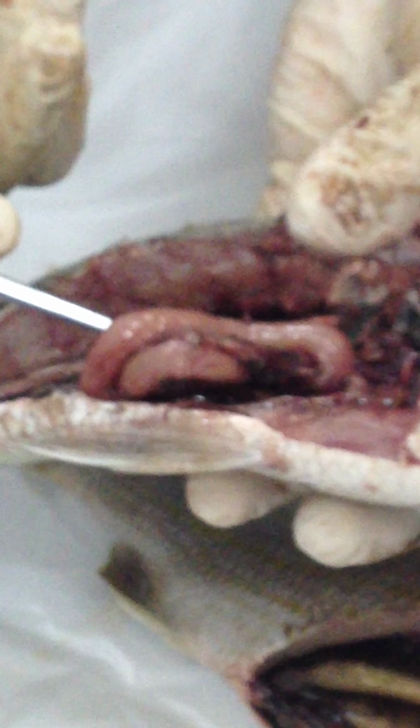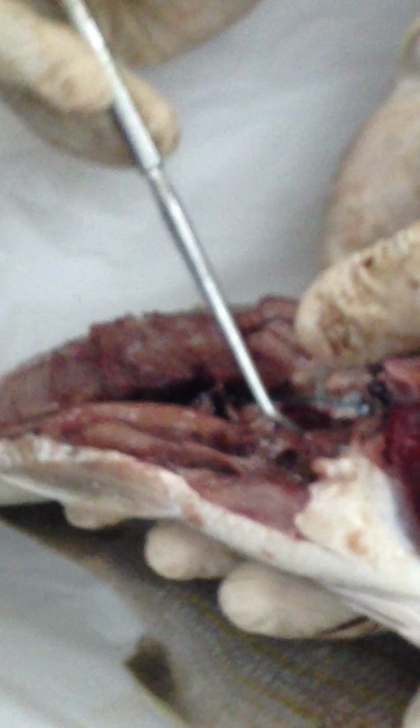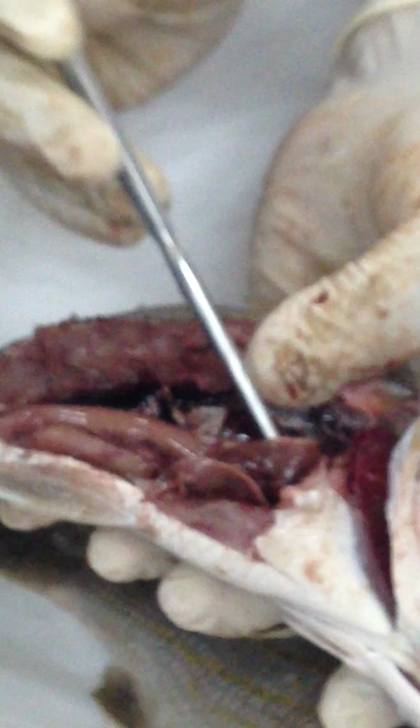Then this is the small intestine. Okay, this is the lobe of the liver or hepatopancreas on this side, and that's the stomach right here. Where's the stomach? Okay, that white thing. I can see another fish in the stomach of this fish. Not really see, but I can feel that one. So the probe is in the stomach now. I can see there would be a partially digested or decomposed fish in there.